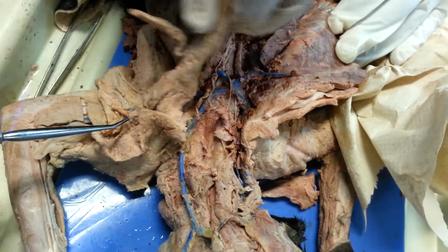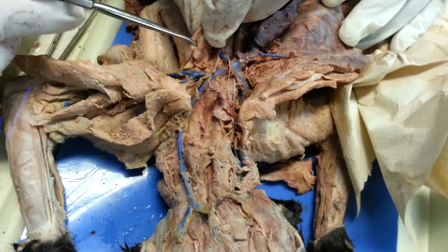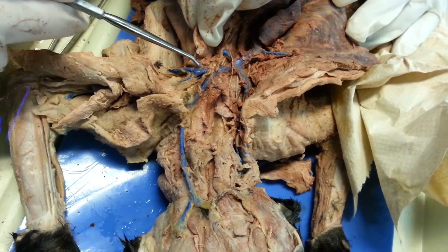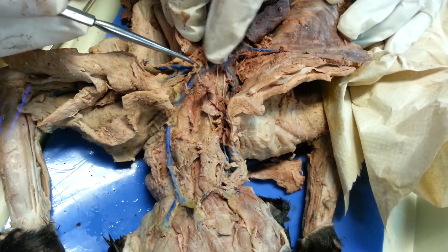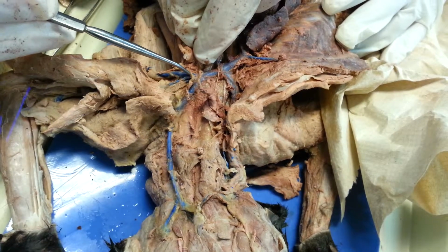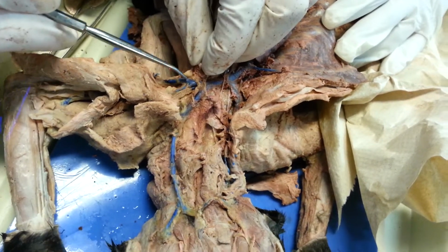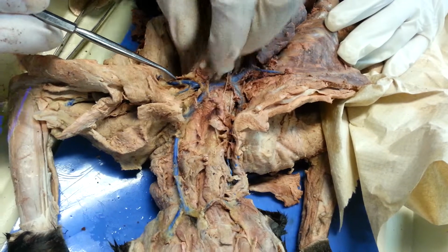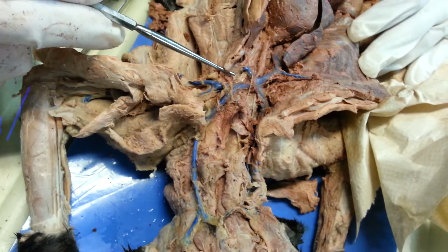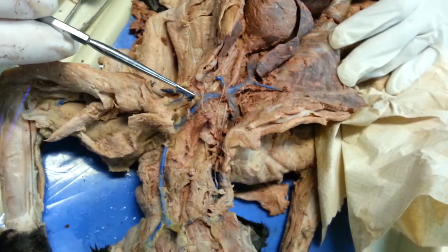Once we get through, the superior vena cava. You can feel the ribs here right now. You can see them. Once this vessel passes out of, so here's the subclavian. As long as it's inside the thoracic cage, it's the subclavian. As soon as it passes outside of the thoracic cage, beyond the ribs, now it's the axillary. So the rib is the mark for subclavian to axillary. The one that gets out of it becomes axillary. Make sense?